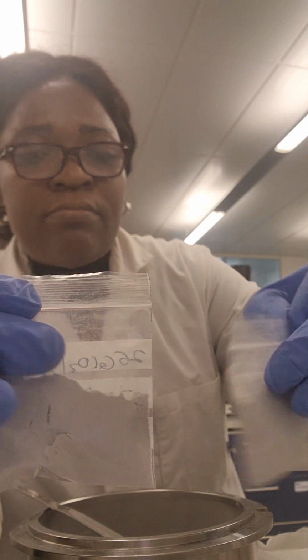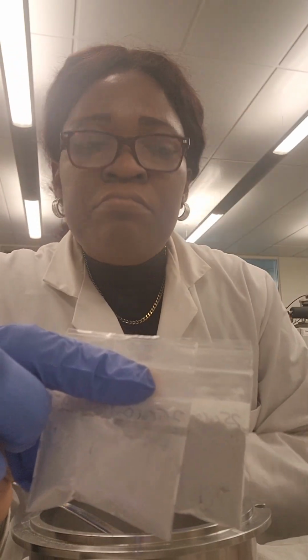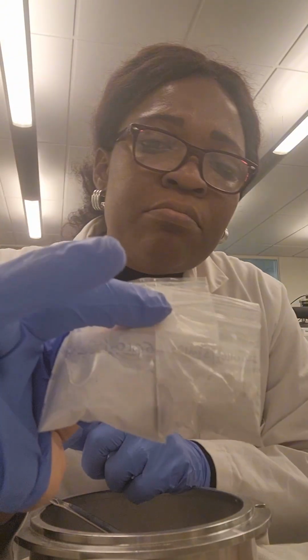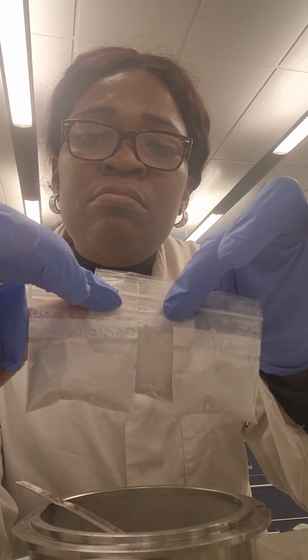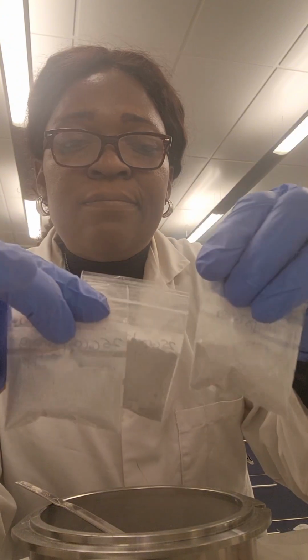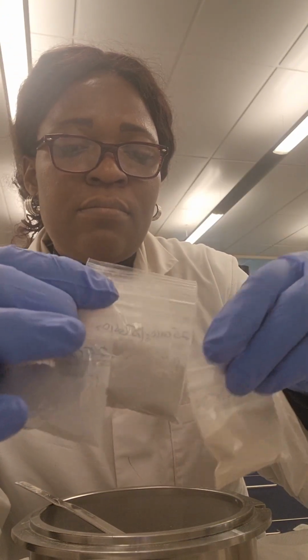I hope you appreciate this. I hope you adore this. I hope this inspires someone to think of researching, because that is what makes technology what it is, research and development. So this is me in the lab looking at different glass samples and comparing what happens, just observing and seeing, and ready to carry out further analysis.